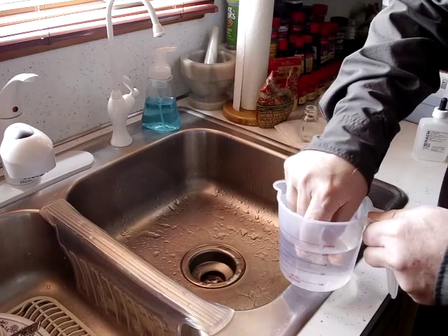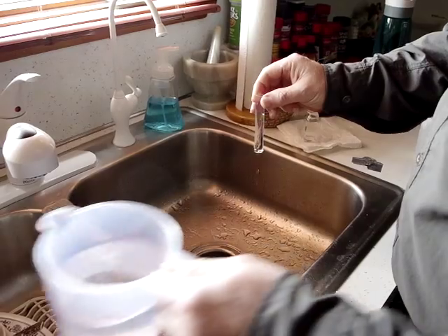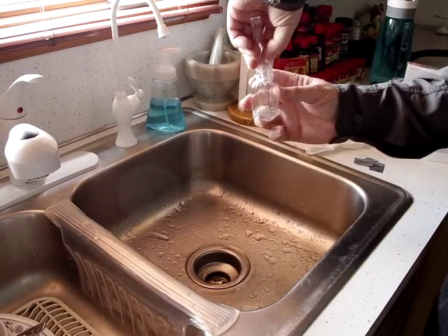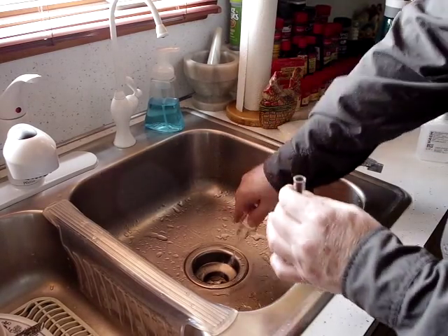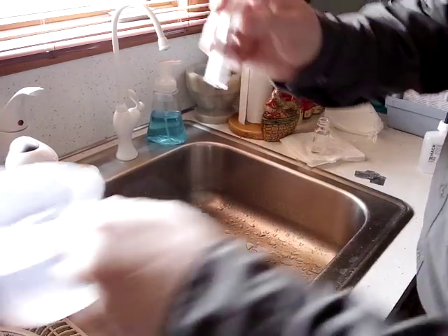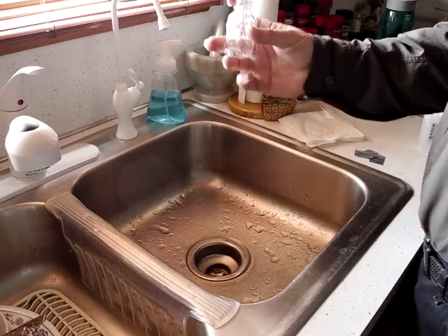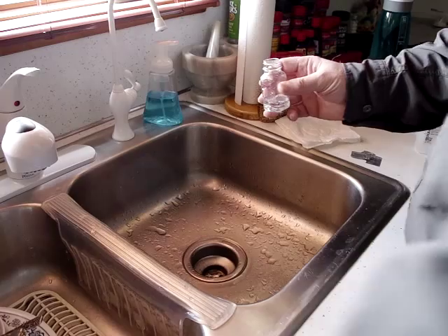Shake it three times, and finally you're going to fill it right on up — this is going to be your known quantity — put it right in there. I probably should have shaken that a little bit more to empty it out, so I'll redo that. Shake them dry basically. Get my water again, over the top, down inside, and I'm done with that for now.